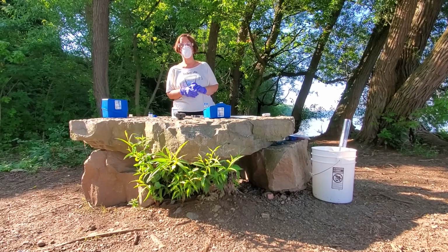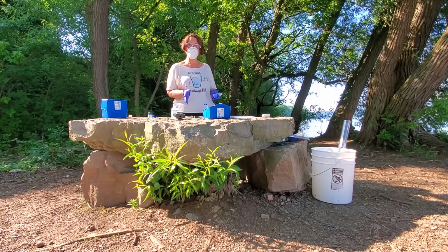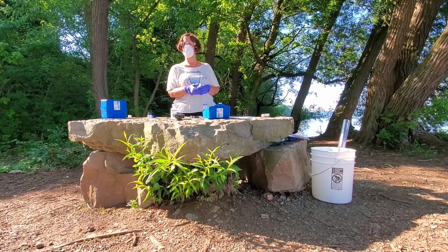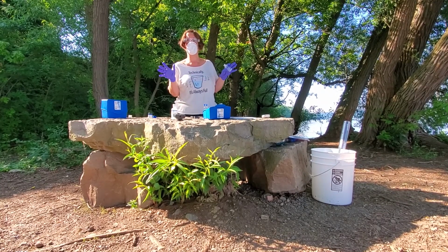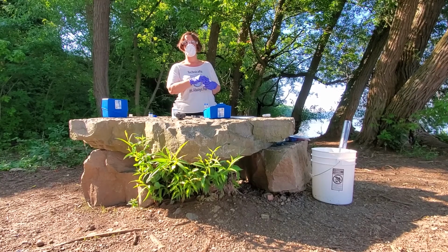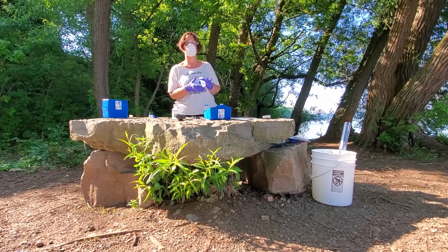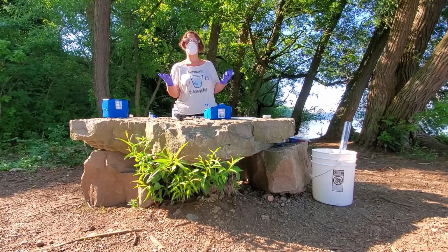Now we are going to test the water for nitrates. The presence or the absence of nitrates is very important because nitrates are fertilizers. They cause the plants and particularly algae in the water to start growing and growing and growing. How do nitrates get into the water? Well, runoff from land that is being used for farming that has been fertilized or possibly from factories or something like that. Once the nitrates get into the water, the algae can begin to grow.